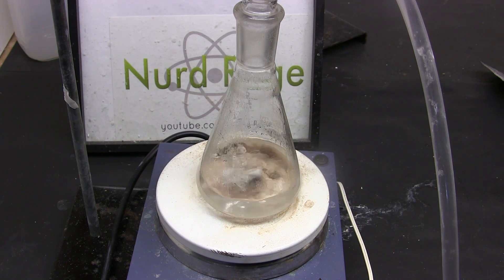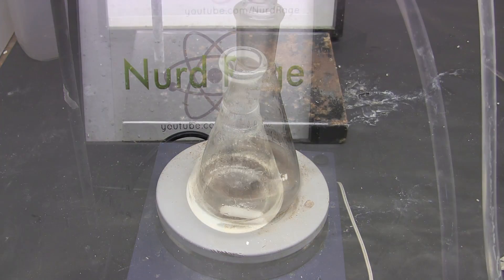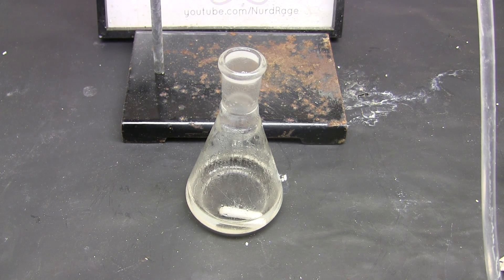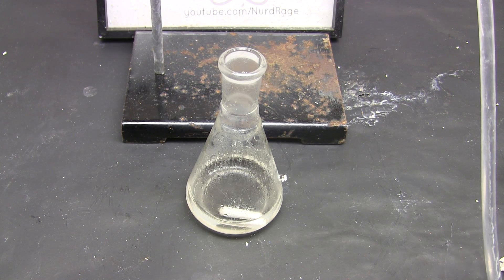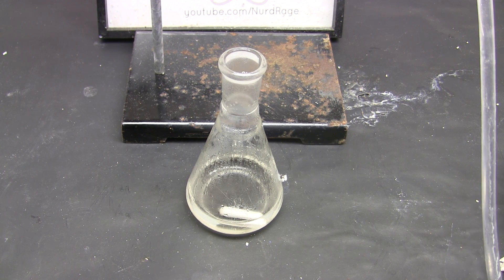I refluxed for 3 hours but this might be excessive. You can probably stop after 1 hour. Anyway here we are after 3 hours of refluxing and the flask is cooled. I've also removed the reflux condenser.